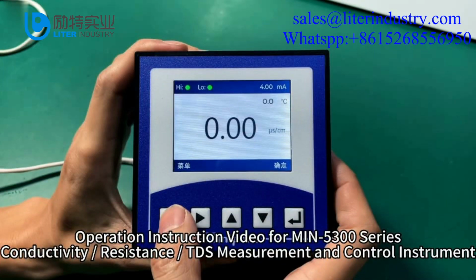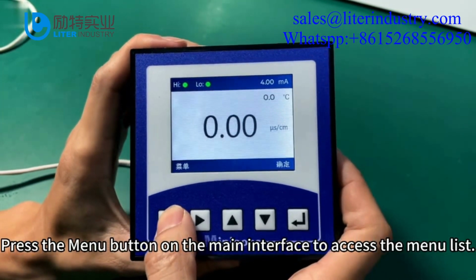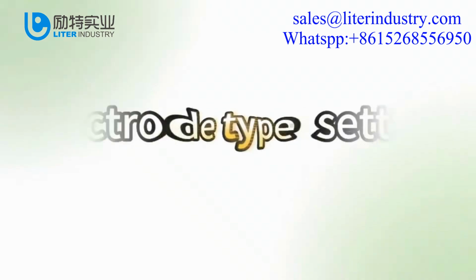Operation instruction video for MIN 5300 series. Conductivity resistance, TDS measurement and control instrument. Press the menu button on the main interface to access the menu list.